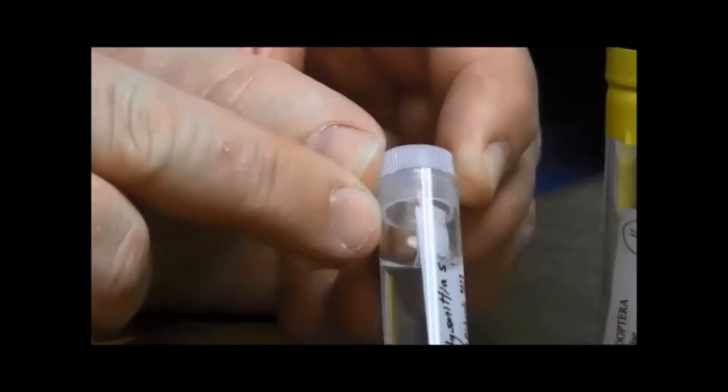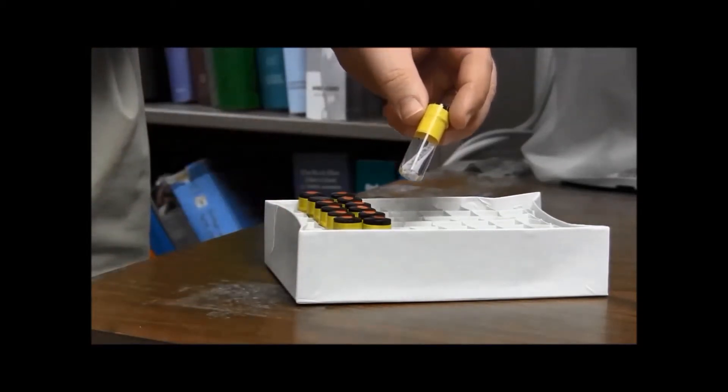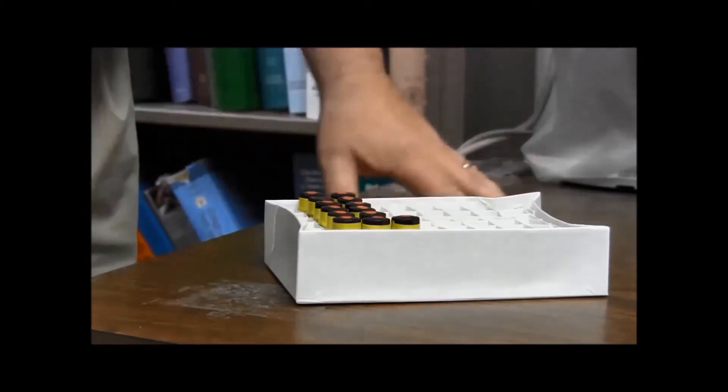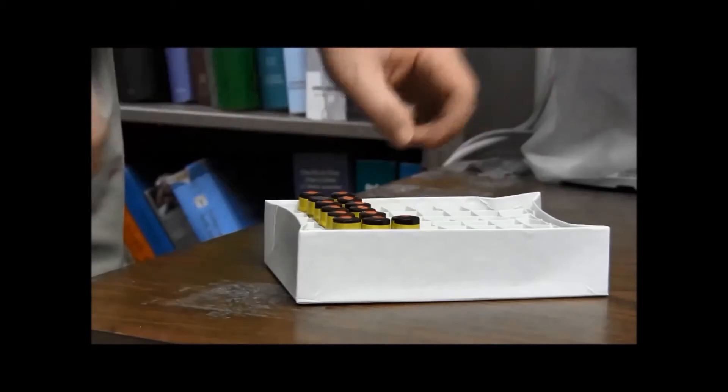Make sure that you leave enough head space within the vial so that when the alcohol expands, it won't pop off the cap. So here's a sample that I'm getting ready to ship. I've already taped all the vials and I've placed them in a vial tray. It's a real convenient way of packaging the vials.